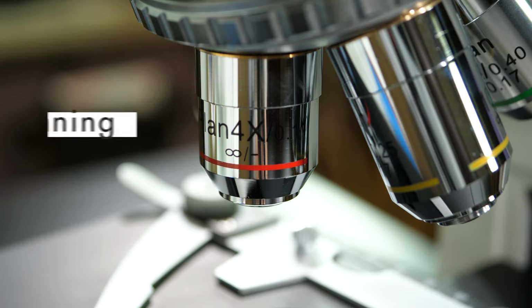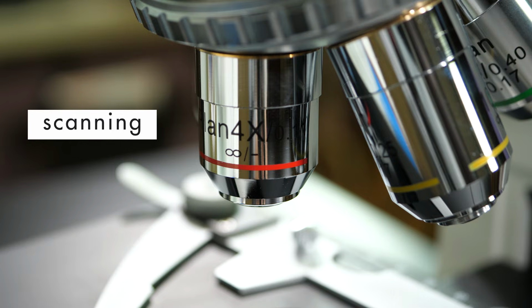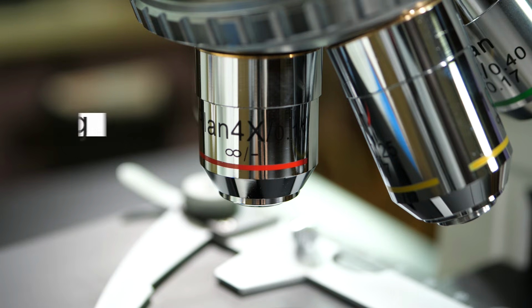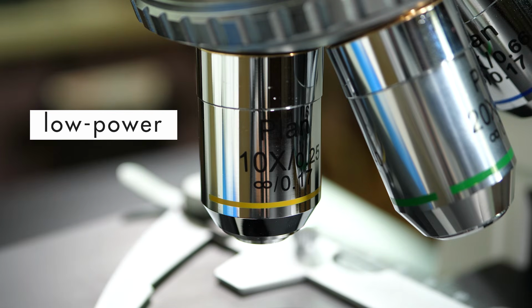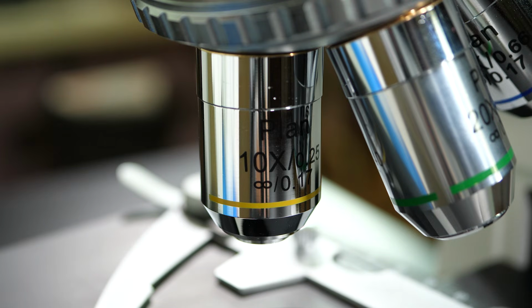The shortest objective lens is the scanning objective lens, which has a magnification power of 4x. A 4x magnification means that the lens is capable of magnifying an image 4 times as large as the actual object. The low-power objective lens usually has a magnification power of 10x.